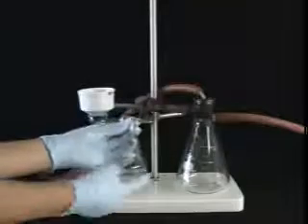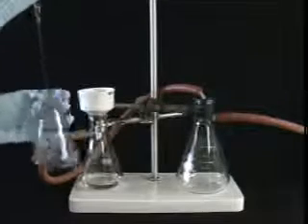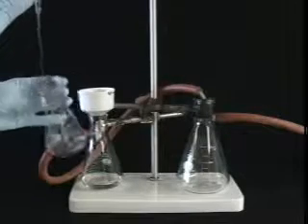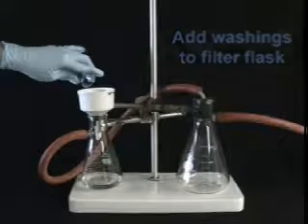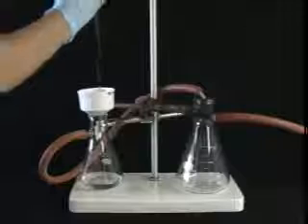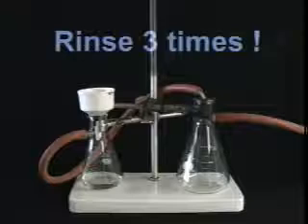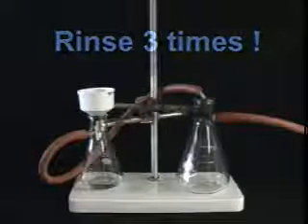We can't forget that rinsing, though. As usual, there's residual mixture left. Rinse the flask with solvent, allowing it to run down the sides and pick up any residual mixture, and add these washings to the filter flask. And remember to rinse the filter paper with solvent as well. Round and round goes the pipette. You should rinse your flask and the filter paper in the funnel 3 times each.